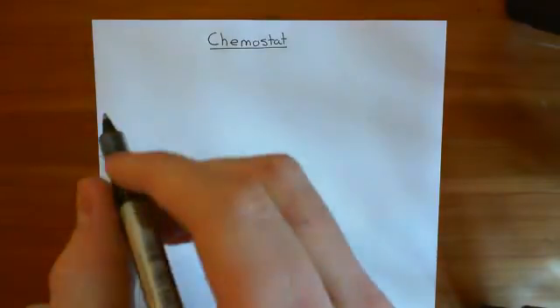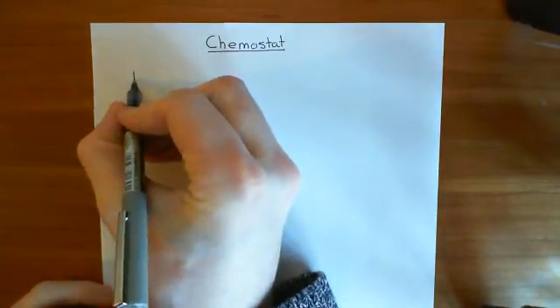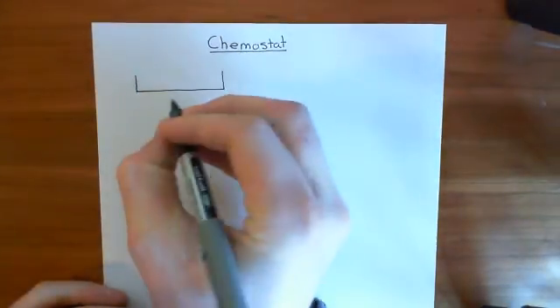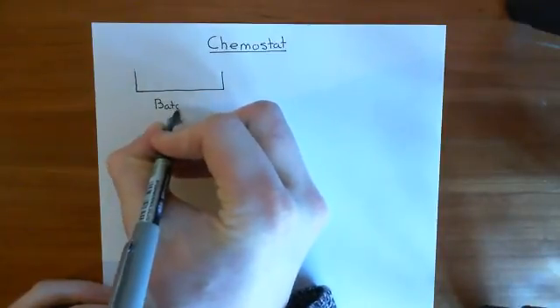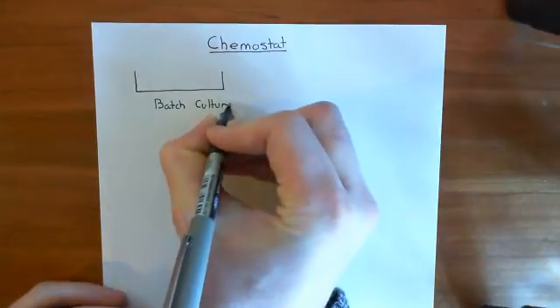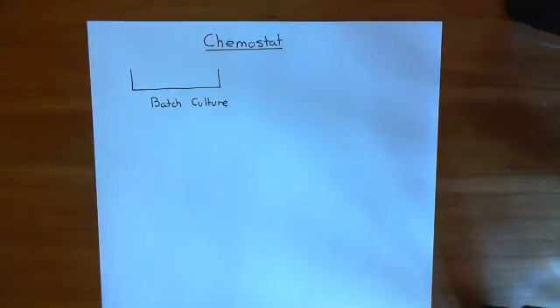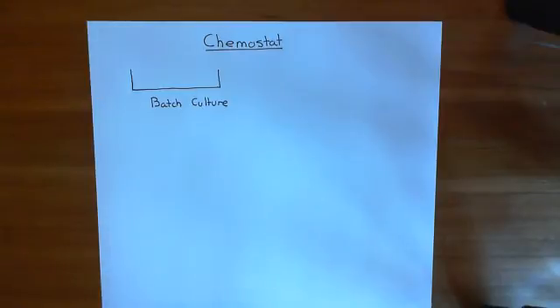There are two ways you can culture bacteria. You can do what's known as a batch culture. This is not a long-term way — it's something you can use to get some bacteria and get them to grow for at least a little while, but it will eventually fail. It's a batch process. You make a batch of bacteria which you can then use, but it's not a process where you can actually keep them living there happily indefinitely.